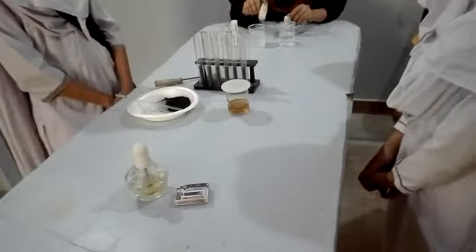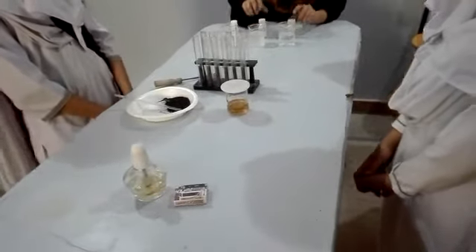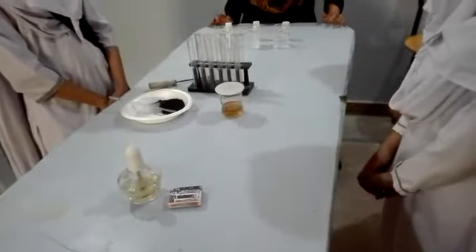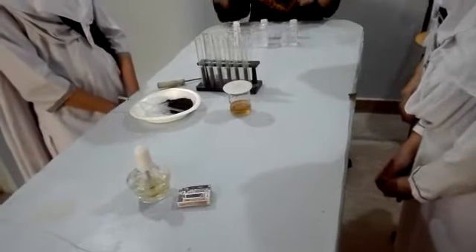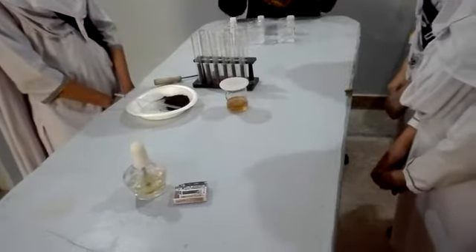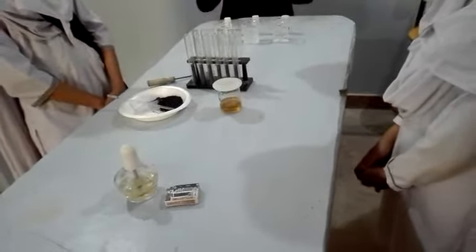One is for iodine, one is for chlorine, and one is for bromine. In lab, when you perform the final lab, you don't know about these solutions — which kind is present in the respective solution. You have to just perform the test to identify these solutions.